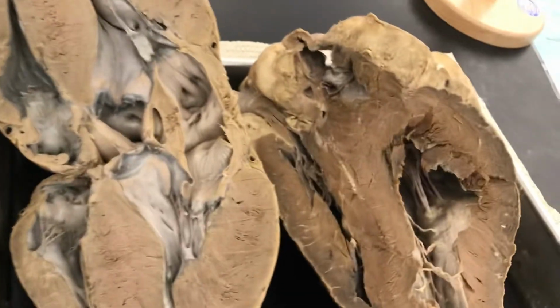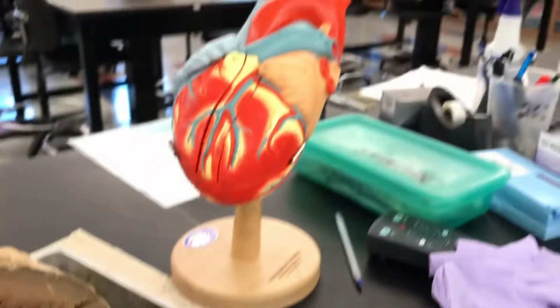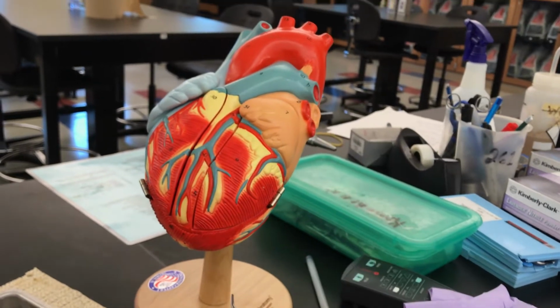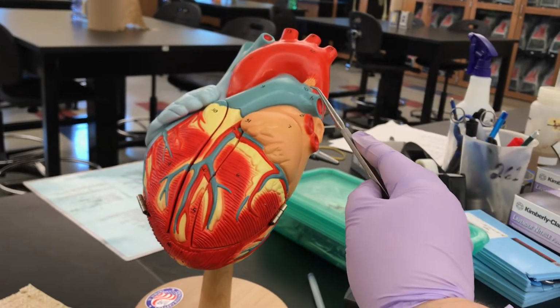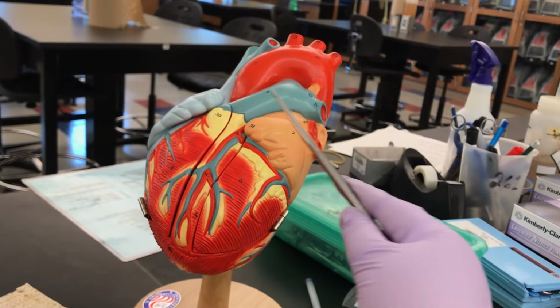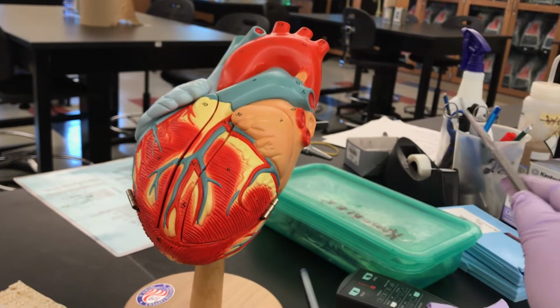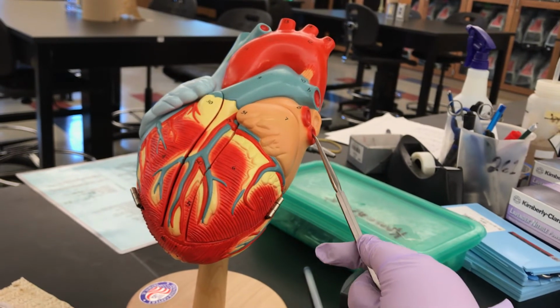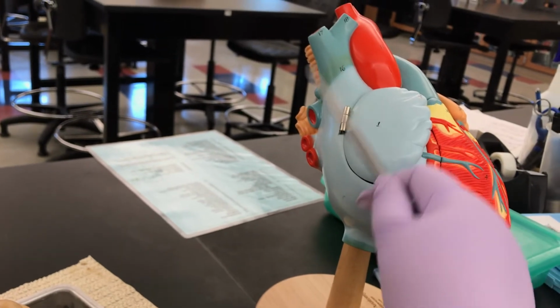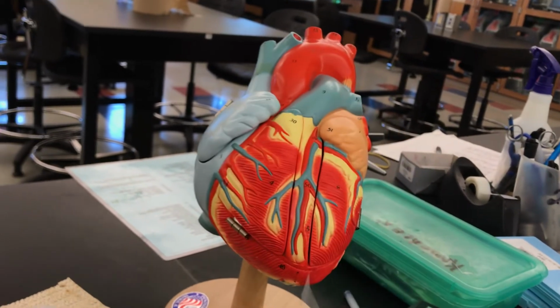That about covers it. Only other thing I can think to ask would be on the heart model. This tiny ligament right here, that is the ligamentum arteriosum. So ligamentum arteriosum. And while I'm looking at this, pulmonary trunk, pulmonary arteries go to the lungs, pulmonary veins come back to the heart. Superior vena cava, inferior vena cava. Other than that, you should see everything else on the real heart.